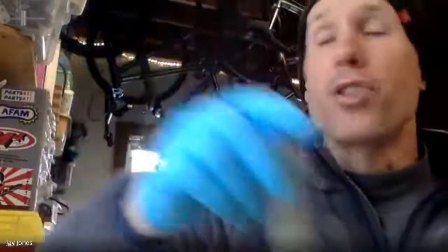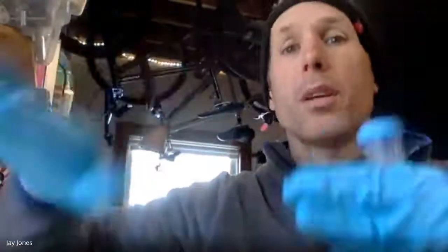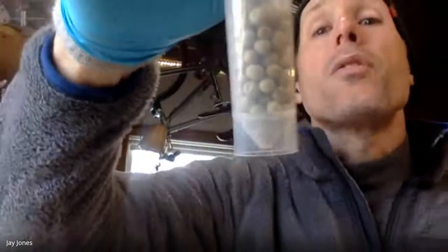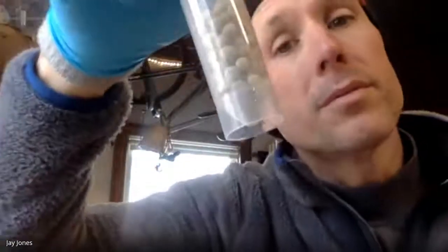The germinating peas should respire. Peas are like animals. They eat food in their endosperm, and they consume the food, endosperm, and they make from that endosperm carbon dioxide and water, like all cell respiration does. And they do it aerobically. Dry peas shouldn't do it at all. So the color for this shouldn't move all that much. It might move a little bit, but not all that much. Or maybe it does a little bit. Maybe they are somewhat active. Maybe.